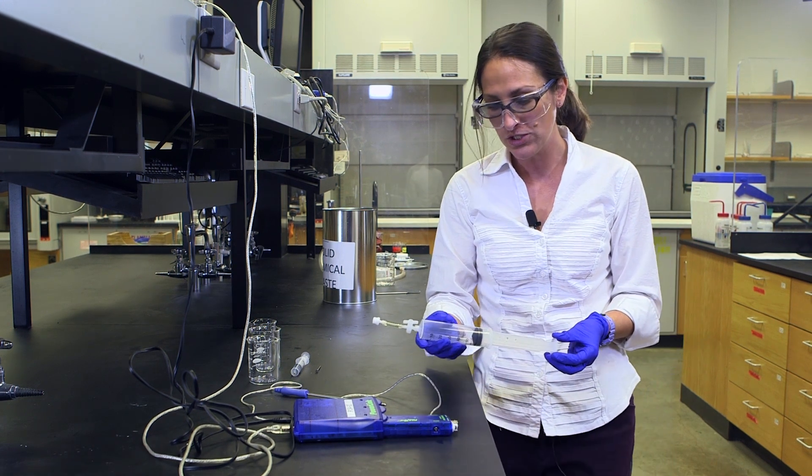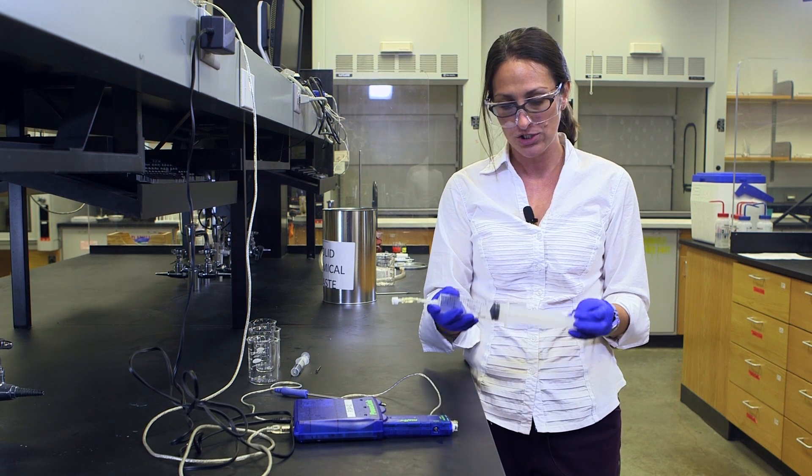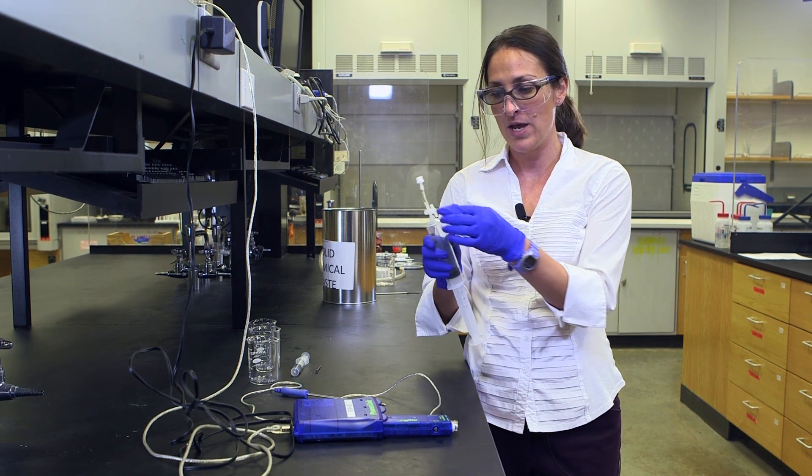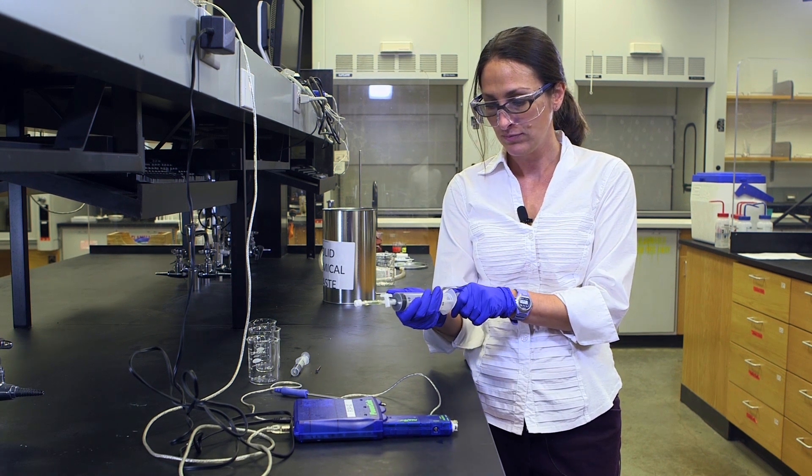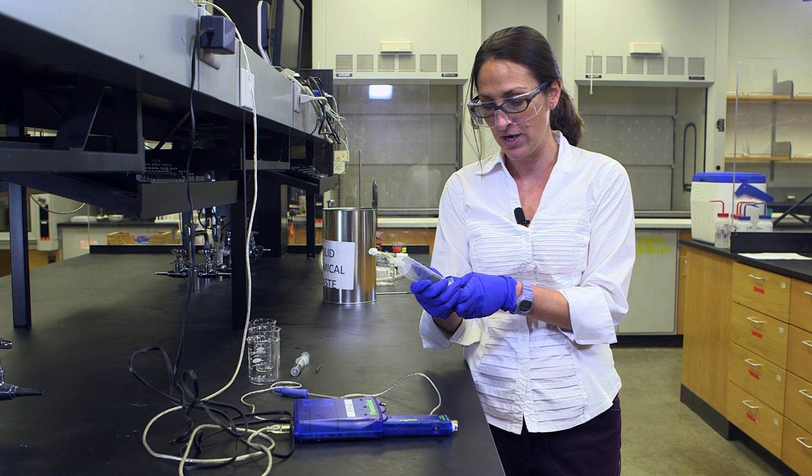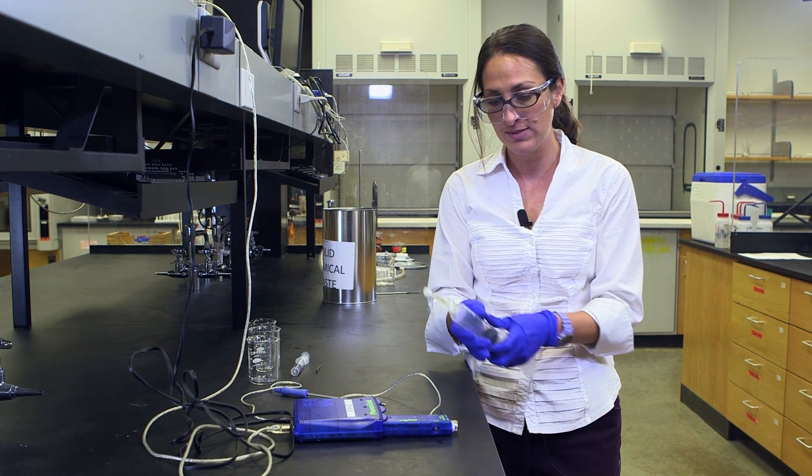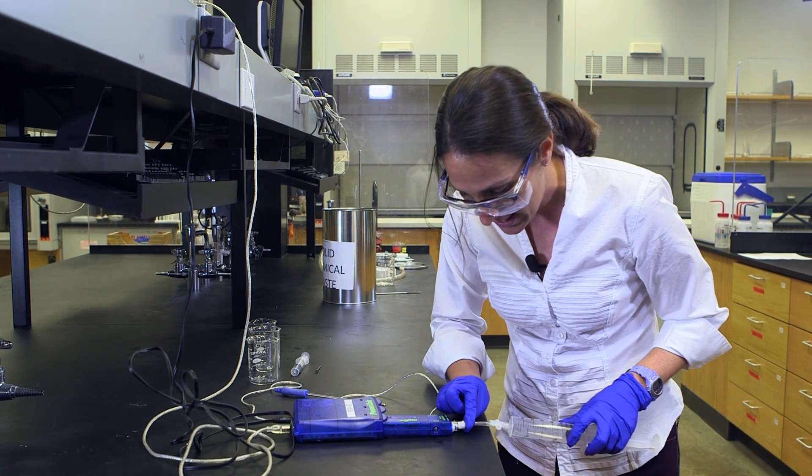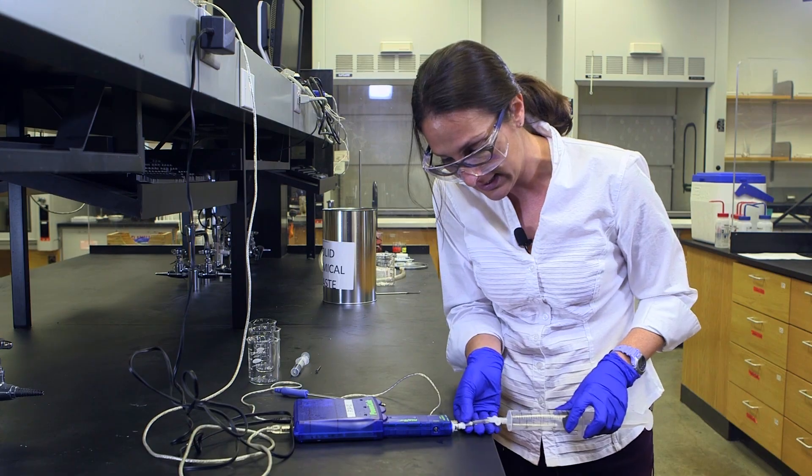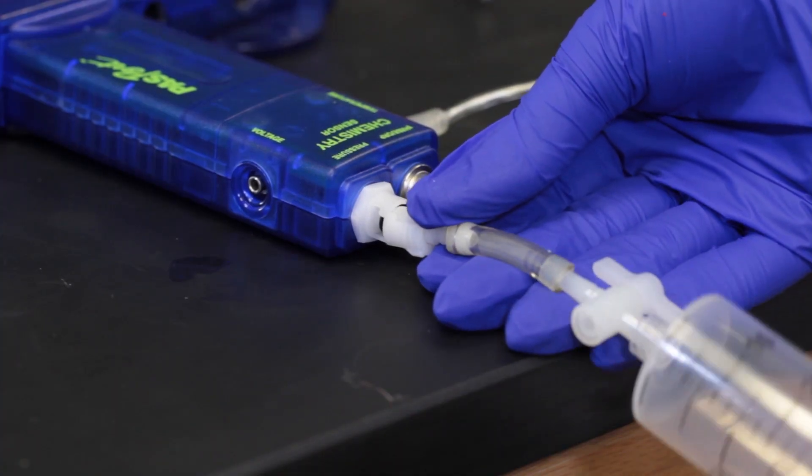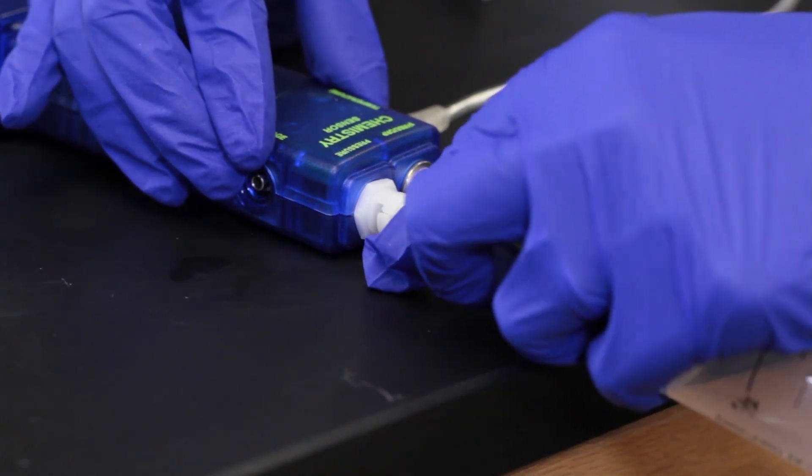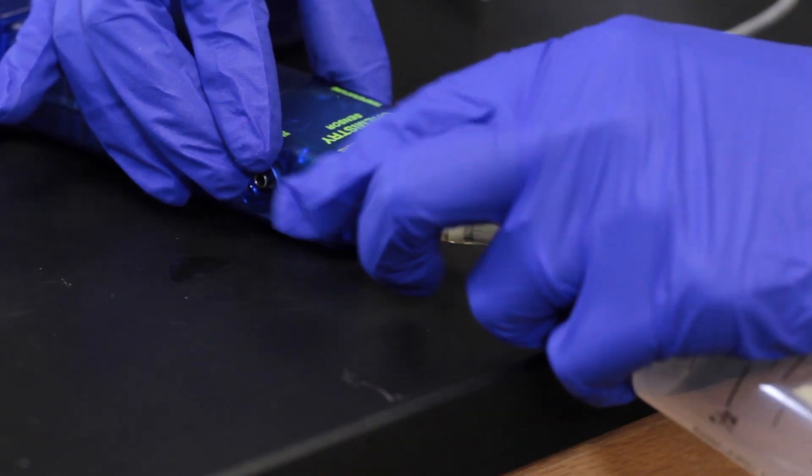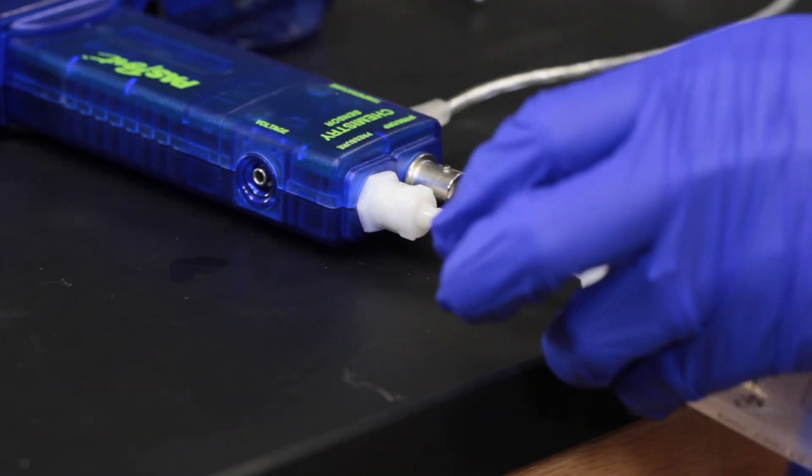The first one we're doing is the relationship between volume and pressure. We're starting with an open port, and I have pulled back to the volume marked on my lab notebook where I'm supposed to start. Then I need to connect to the pressure port. So as I decrease the volume, this instrument is going to read the pressure. I slide it in, and then I click.